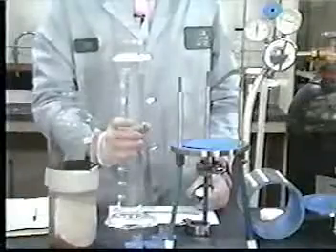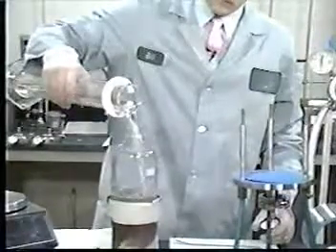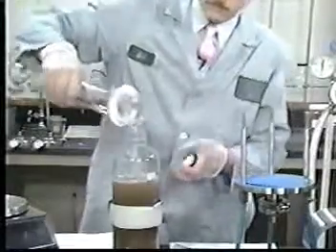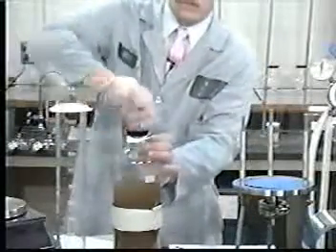The appropriate extraction fluid, as determined from the solid's alkalinity, is then added to the bottle. The amount of fluid used is equal to 20 times the weight of solid being extracted. Seal the extraction bottle with a Teflon-lined screw cap. Secure the cap to the bottle further with Teflon tape. Place the bottle in a rotary extractor.